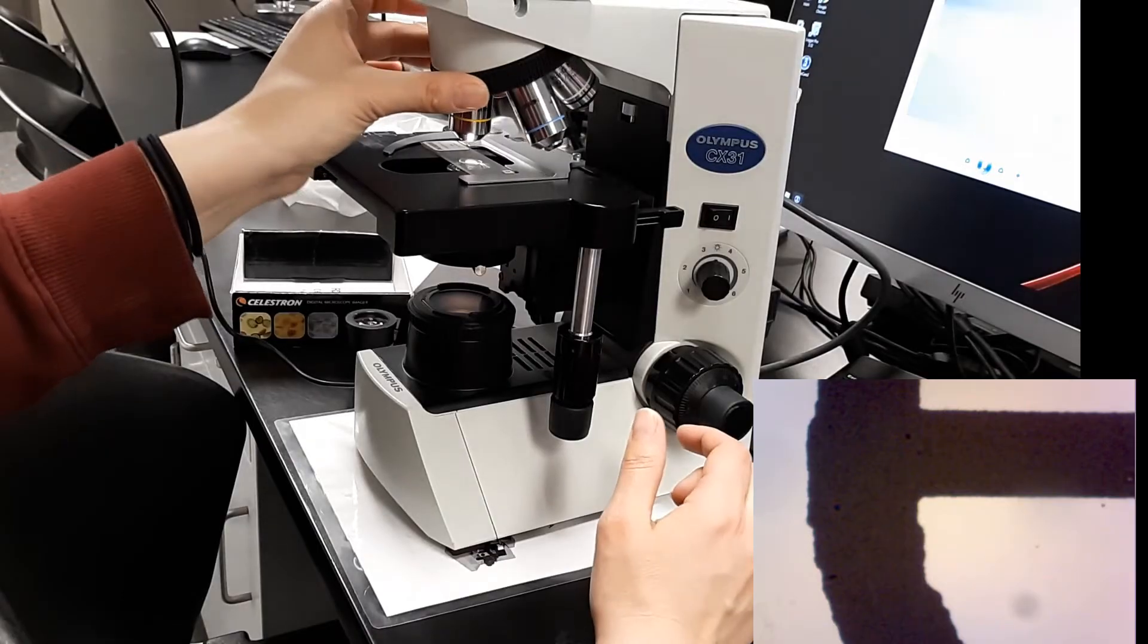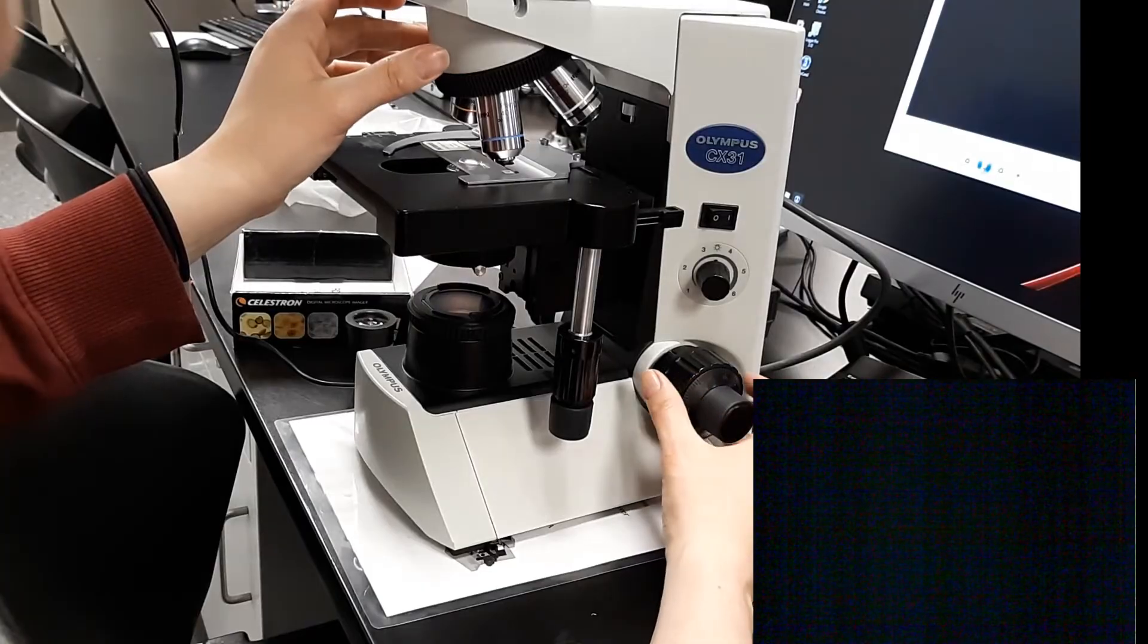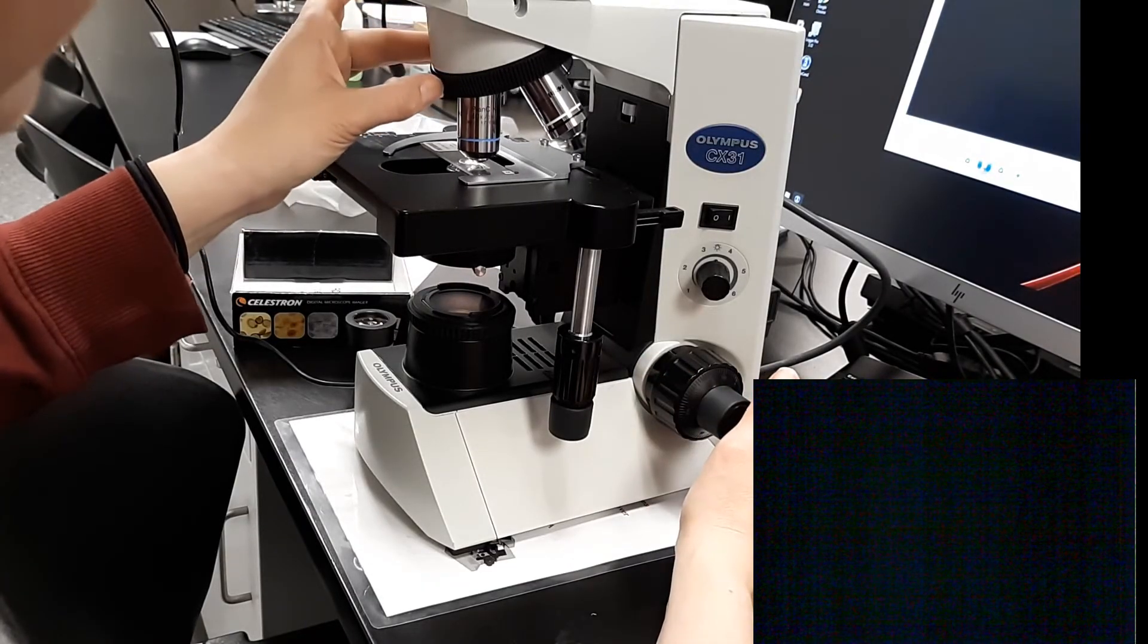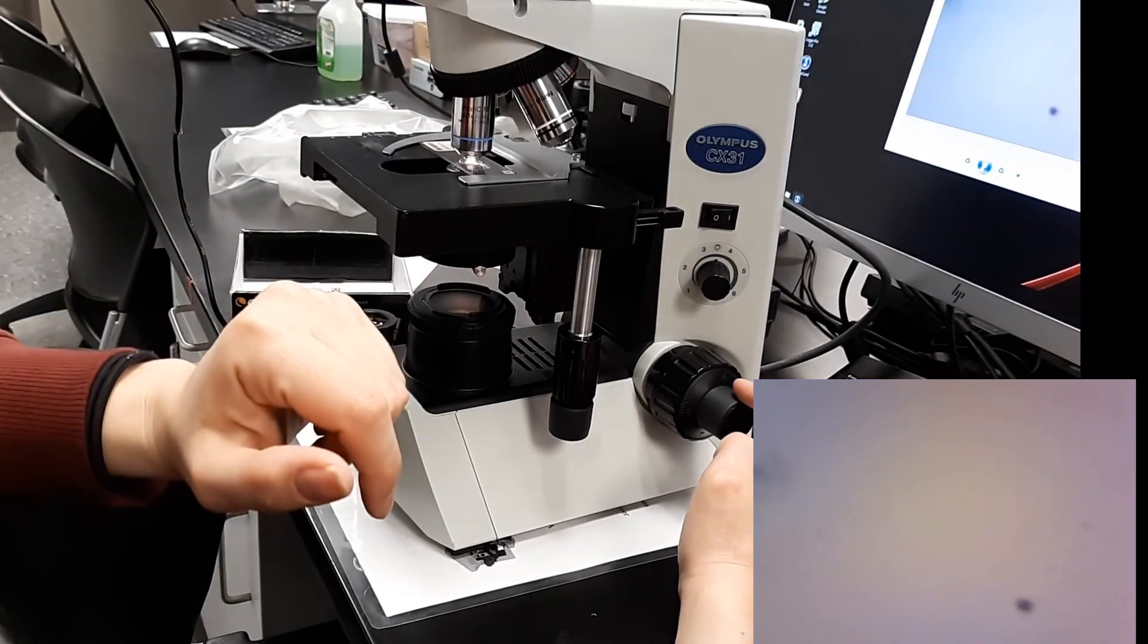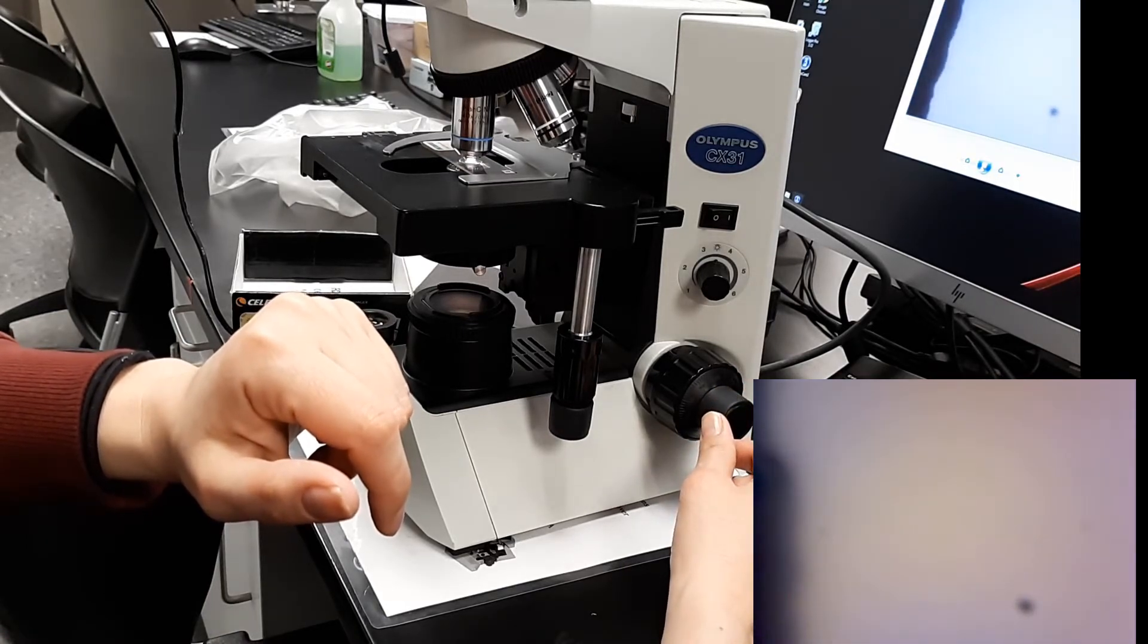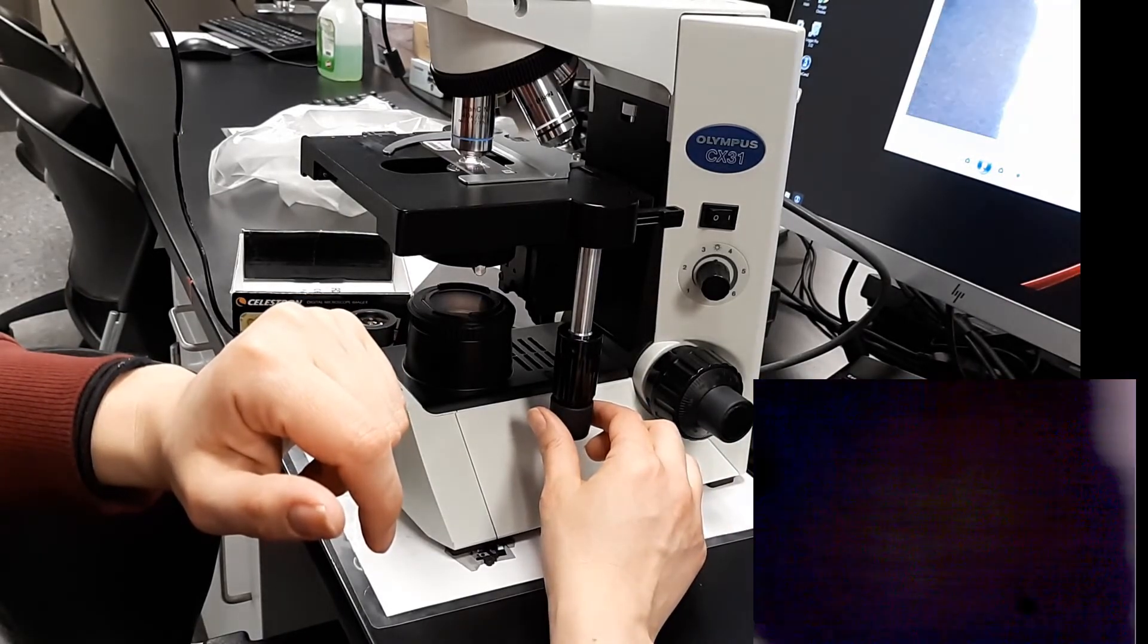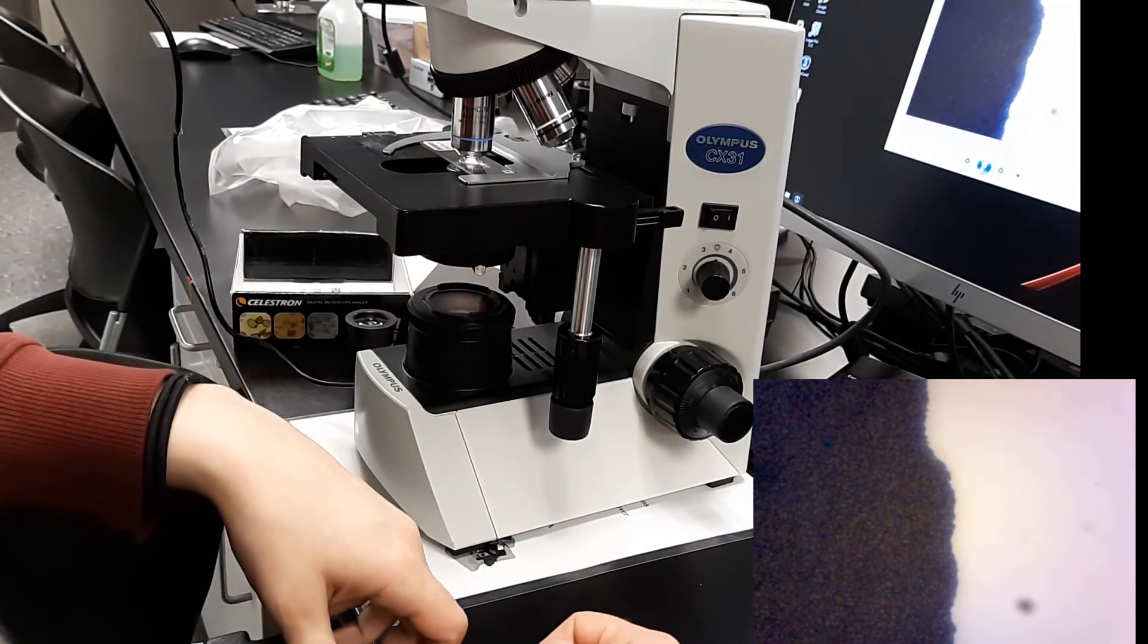And if I wanted to go to blue, I'd rotate about halfway between. Sometimes you can rotate straight in depending on how thick your slide is. I'd go down about a millimeter, rotate toward it. And again, since I'm on yellow and blue, I'm only going to fine focus. I'm going to fine focus away from myself very gently. And you always want to make sure that your specimen, and there it is. And notice as we're getting closer, we're seeing less and less of our specimen. That's because we're zooming in more and more.